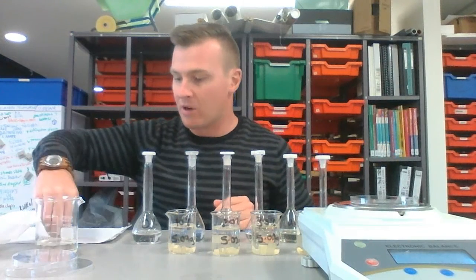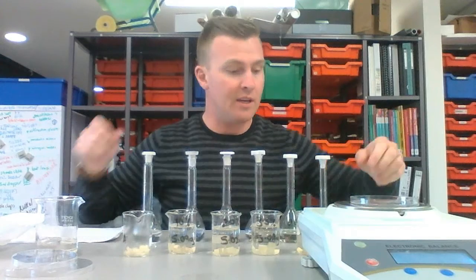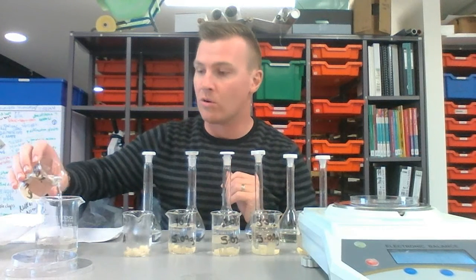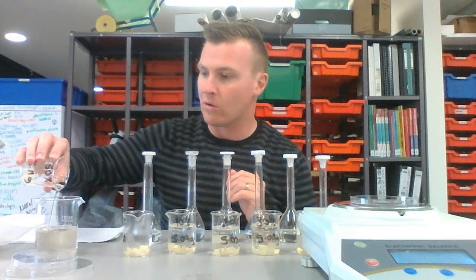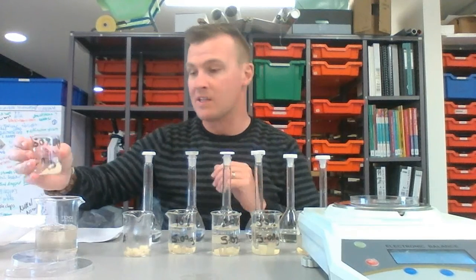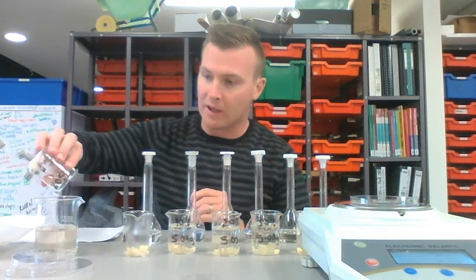Now what I'm going to do, I'm not going to go through all of these and bore you. I'll just go through the 50% one. So this solution was 50 grams of sugar in 100 grams or 100 mils of water, whichever way you want to look at it. This is a solution where the solution is hypertonic and the potato is hypotonic.